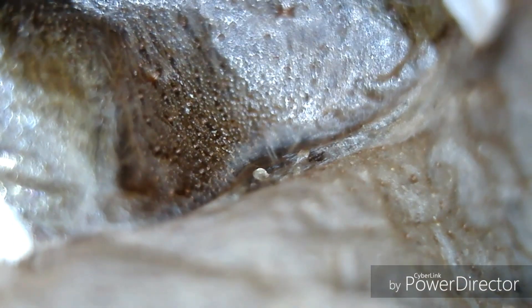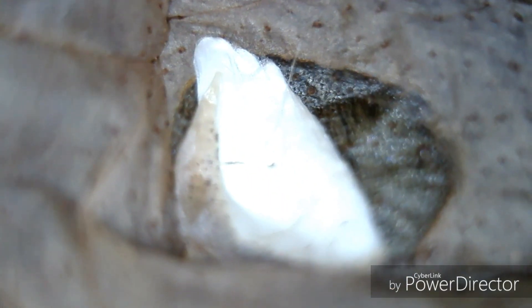Still pretty undeveloped, obviously on a two-inch sling, but it is a female — that is absolutely epic. I was gonna see if I could stick my dental pick in there and kind of show you exactly where I'm talking about, but I'm just gonna end up moving it all over the place. The shaking is extremely too bad for this.